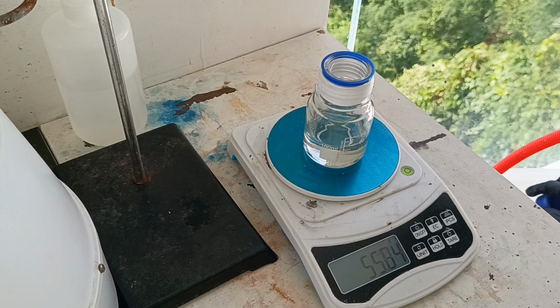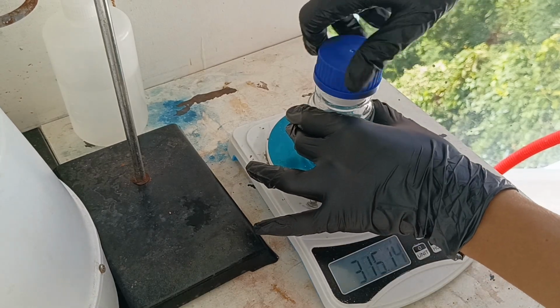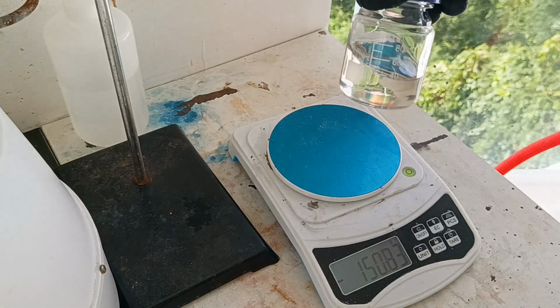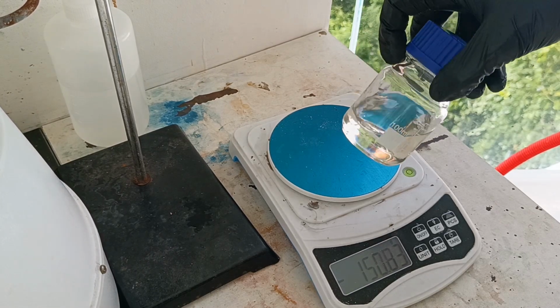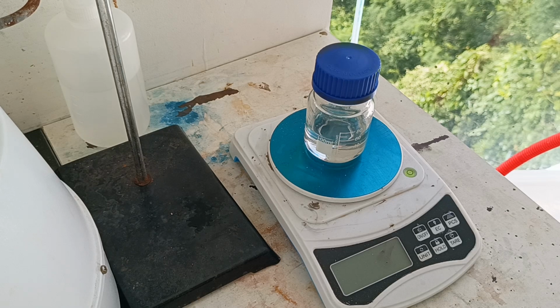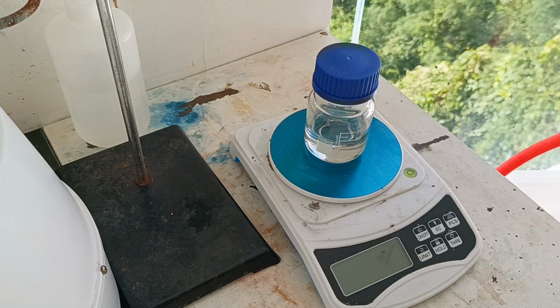The final yield of phenol was 55.84 grams, which corresponds to a 57% yield. Just so you know, making the phenol doesn't really require potassium carbonate and copper oxide. It can even be done just by heating it up, but the reaction is a lot more inefficient, and using copper oxide and potassium carbonate helps improve the yield.